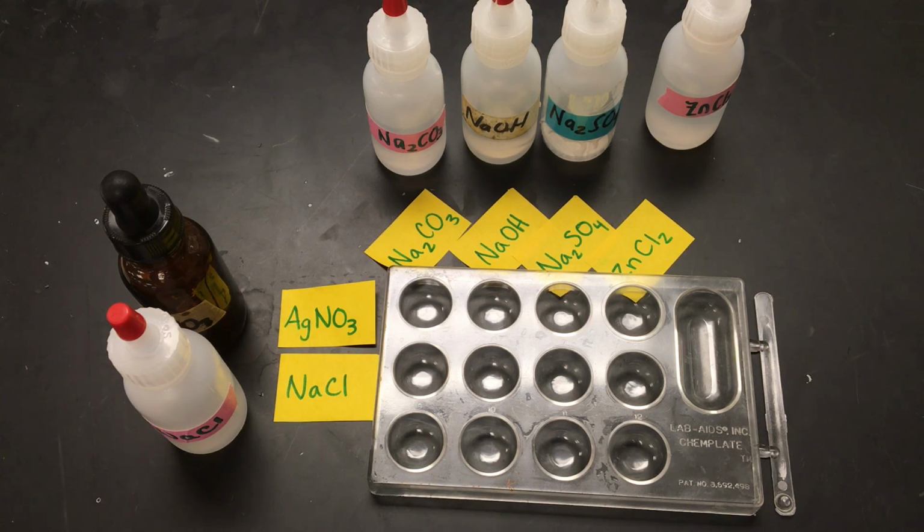Okay, so here we have a little well plate with all of these little wells where we're going to do our little reactions today, and we're just using a well plate instead of beakers so we can do all 12 of these reactions and see what we need to see but not have to clean up a whole 12 beakers. So all we're looking for here is where a precipitate, a surprise solid, is formed.